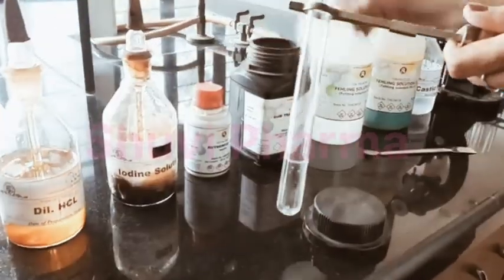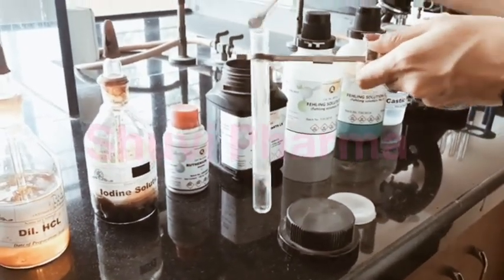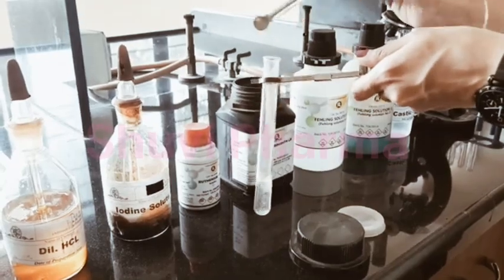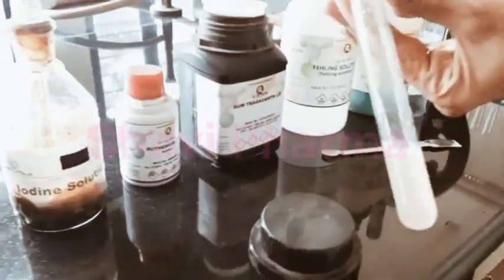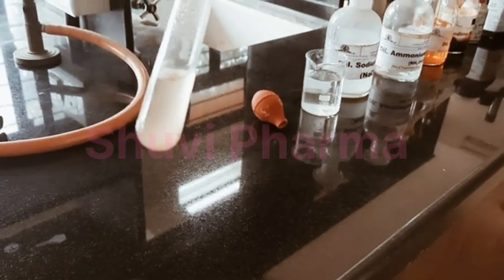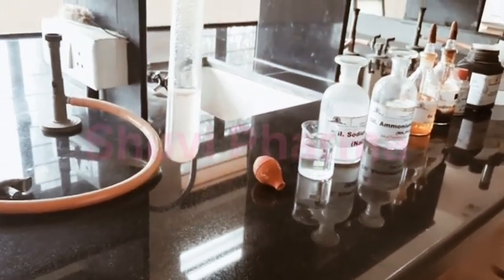For the second solubility test, warm water is taken into the test tube. To that we will add tragacanth powder. Here you can see the drug is soluble in warm water. It indicates the presence of tragacanth.